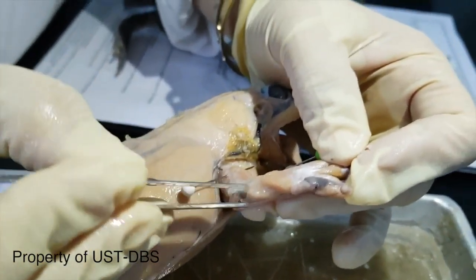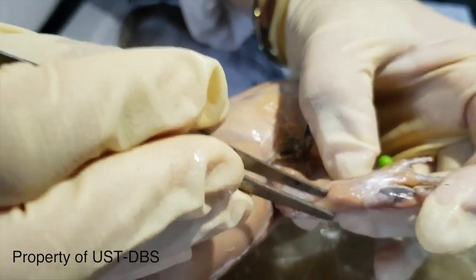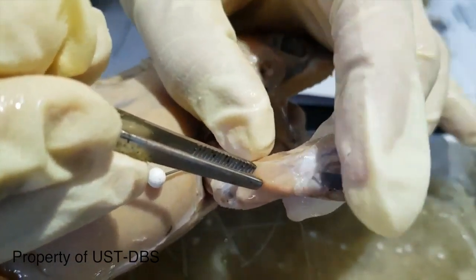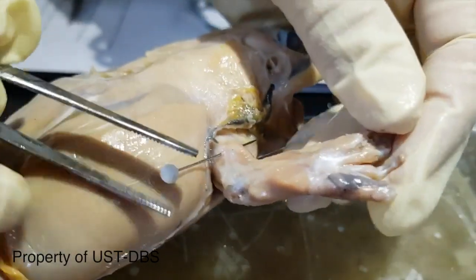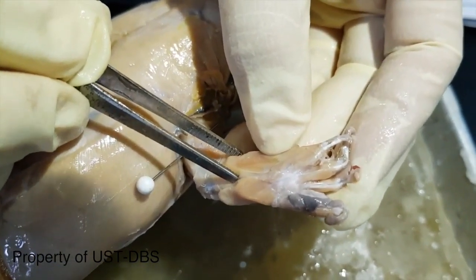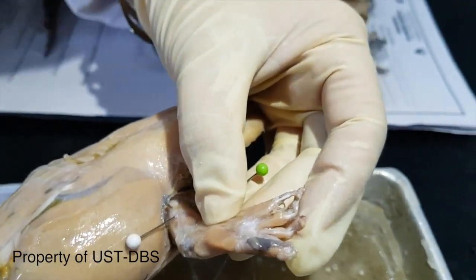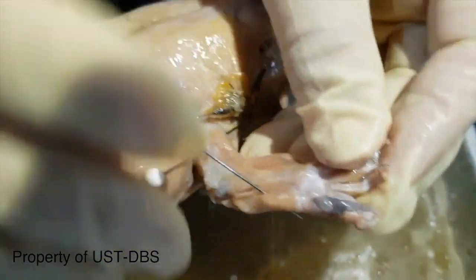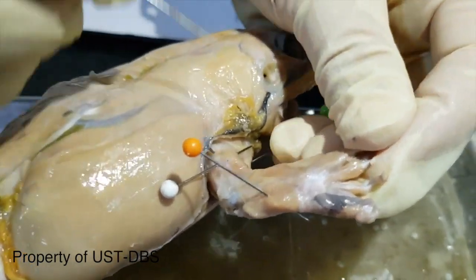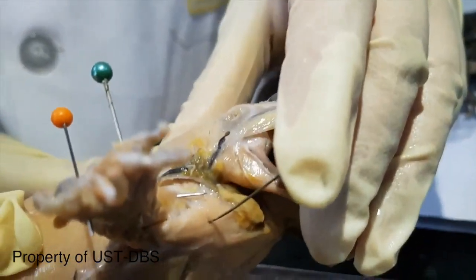The muscle that covers the elbow is the anconeus. This muscle here on the ulna side is the extensor carpi ulnaris, and this muscle here on the radial side is the extensor digitorum communis. So: extensor carpi ulnaris, extensor digitorum communis, triceps brachii, deltoid. Okay.